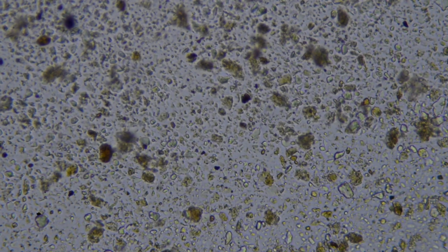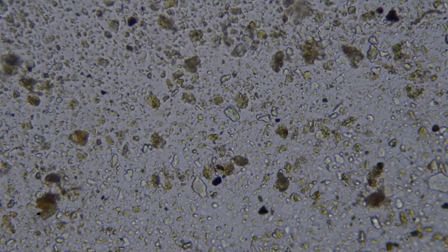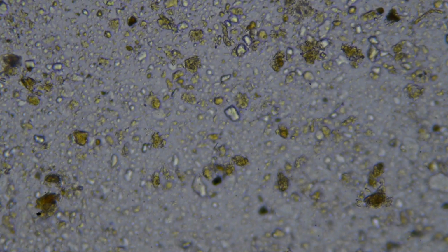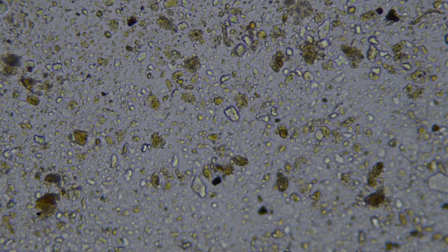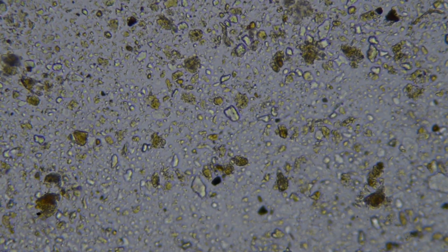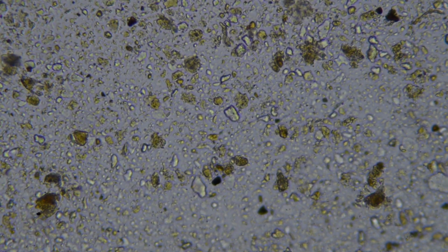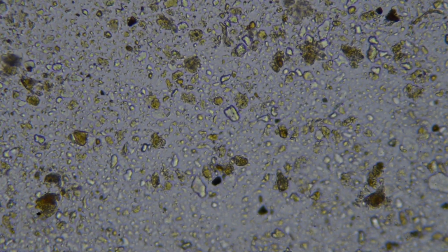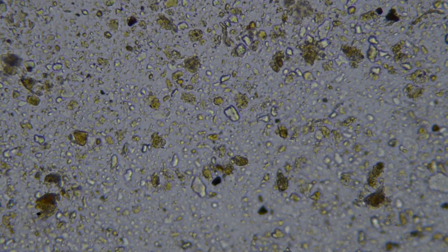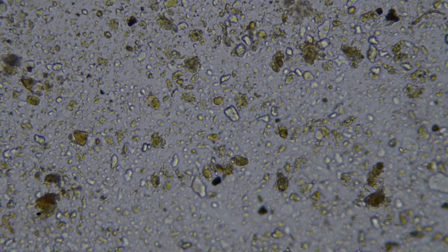So what we're doing here in a healthy soil sample, and this is applicable to agricultural fields, we're looking to see at least a fungal hyphae per field of view at this kind of magnification. So you can see we're seriously lacking in fungal activity. The other thing that's worth noting is I haven't seen a single fungal spore yet. So it's my guess there's been really quite a long time since any fungi have been active in this field, because it's quite common to see, fungi can go into survival mode and asexually produce spores if they need to, which can sit dormant in soil for a very, very long time, but I'm not seeing any. I mean, thousands of years potentially.